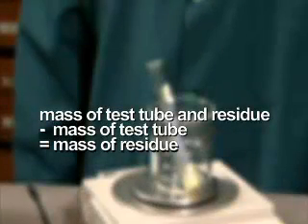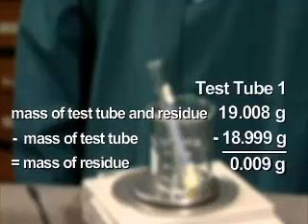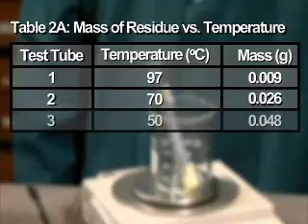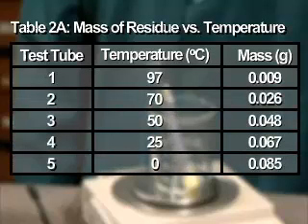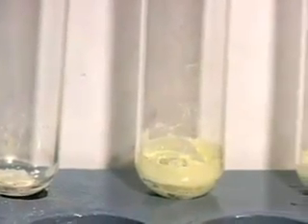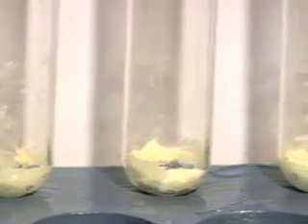The mass of the test tube and residue, subtract the mass of the empty test tube, equals the mass of the lead-2 iodide residue. The mass of the dried lead-2 iodide is determined for each temperature. From the table, what trend exists between temperature and amount of residue? For lead-2 iodide, what generalization can be made about the effect of temperature on the amount of solute that remains in solution?